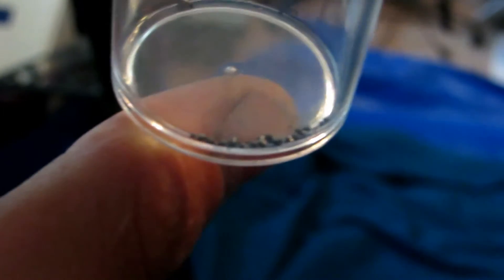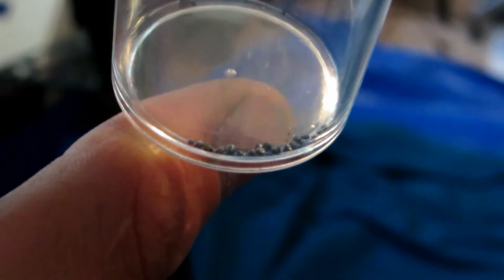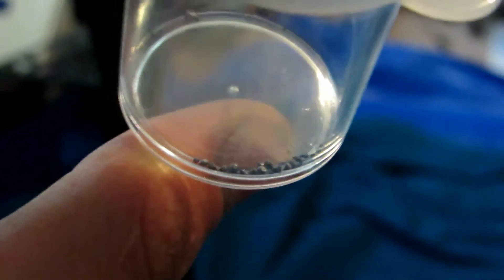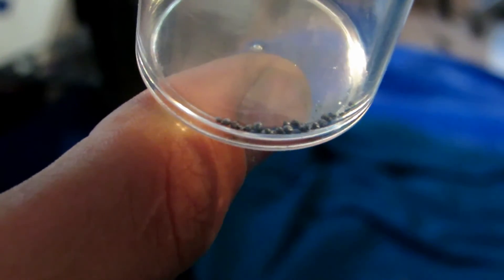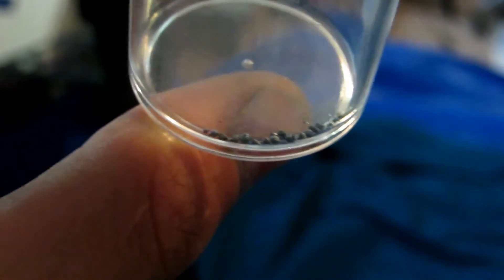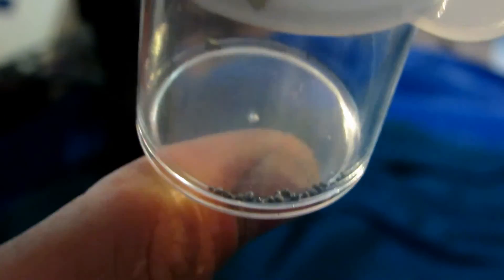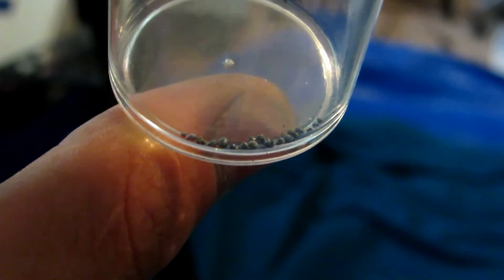As a side note — you can see these beautiful silicon beads here. These are from the remnants of the thermite reaction which I carefully sifted through with my hands until I found these little beads of silicon metal, then carefully picked them up with needle-nose pliers. They're incredibly small, but definitely worth getting if you're trying to get a large amount. Clearly it is possible to make silicon from silicon dioxide as I've demonstrated here, though I really wish there was a better way to get more out.